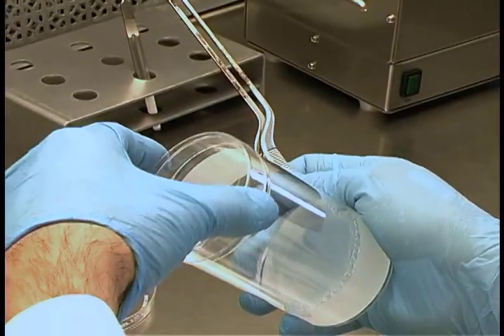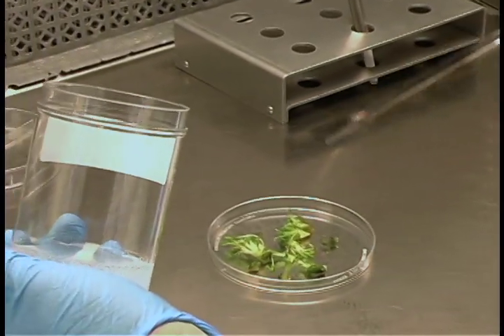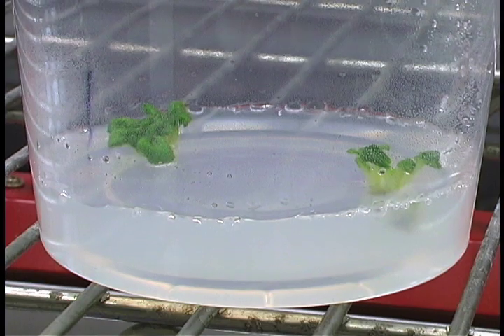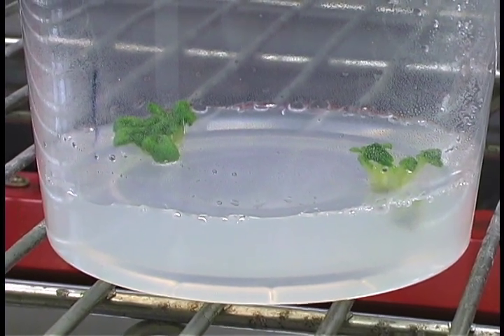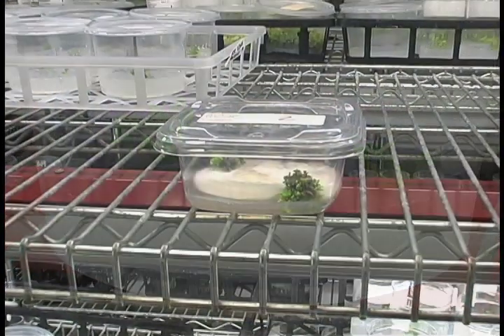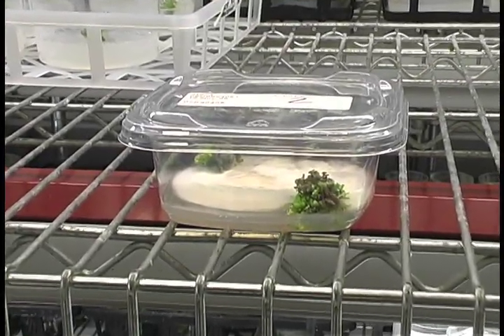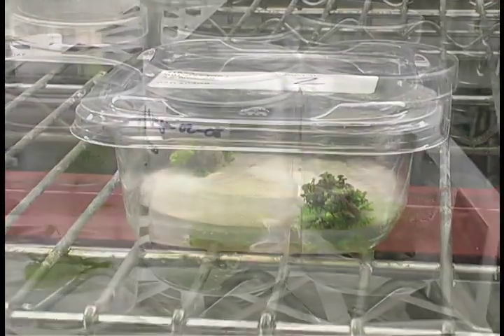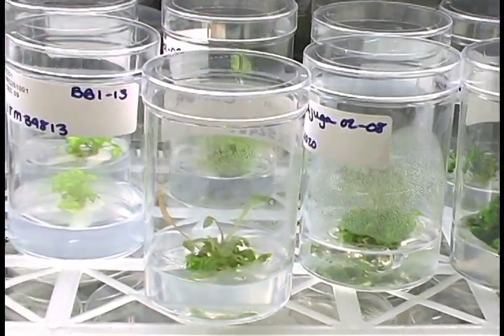In plant tissue culture, small pieces of plant tissue are placed on or in a medium rich in nutrients and sugar. If bacteria or fungi come in contact with the plant tissue or the medium, the culture becomes contaminated. The contaminants — bacteria and fungi — will use nutrients from the medium and quickly multiply and overwhelm the culture. Pathogenic contaminants will also destroy the plant tissue.